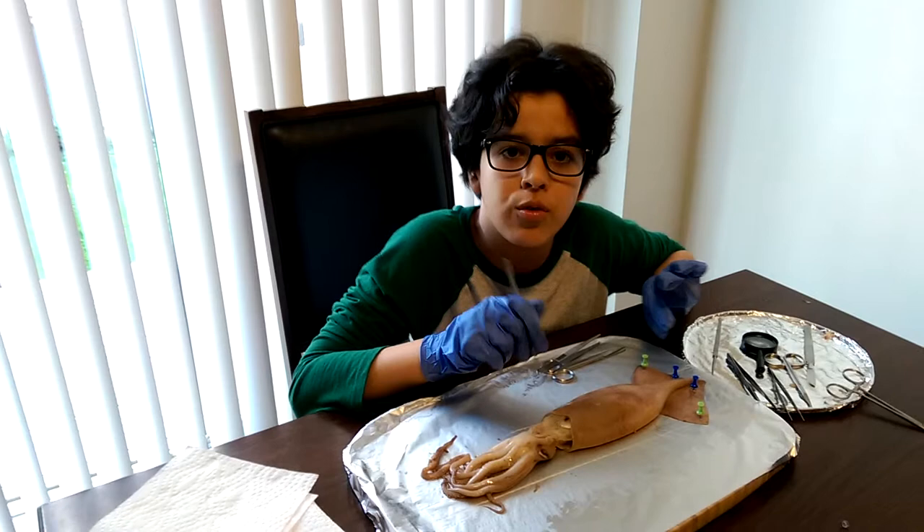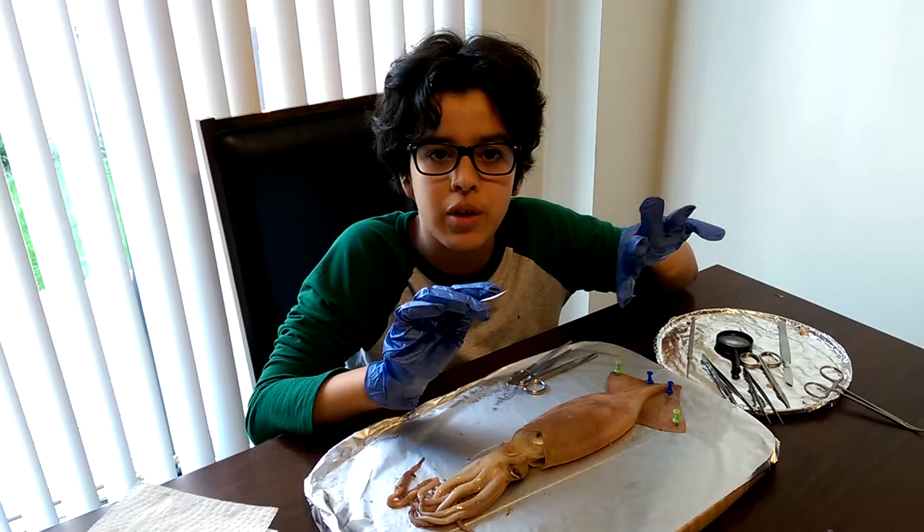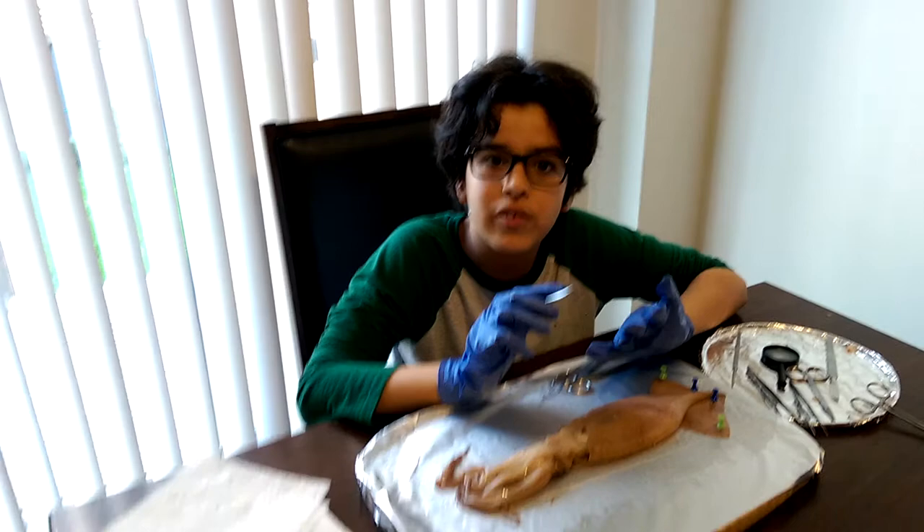This is Mohammed and we'll start reporting again for another video of the dissection. This is part two where we do the fun stuff. I'm going to dissect it, but first I'm going to take apart the skin. Here we go.